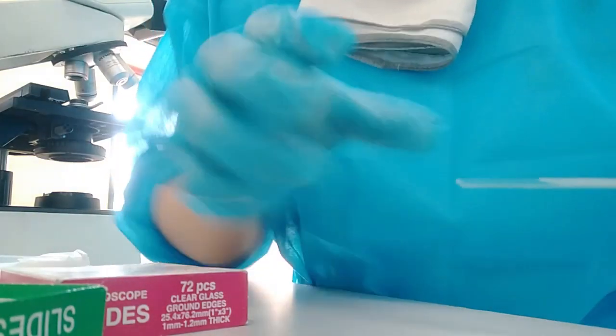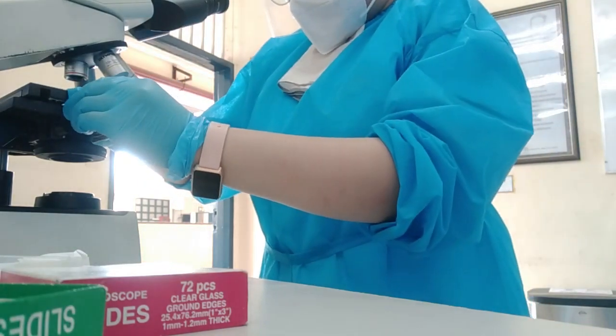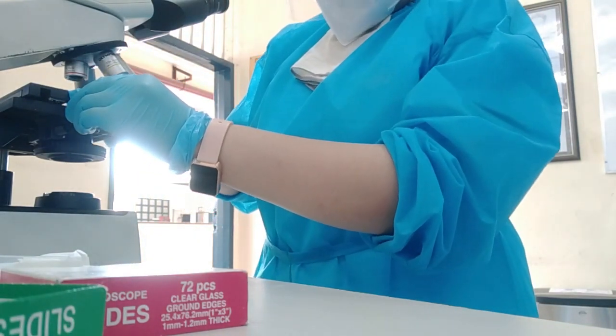Now after that, we view it under the microscope. And this is what is seen under the microscope.